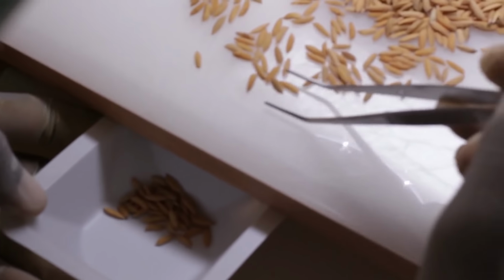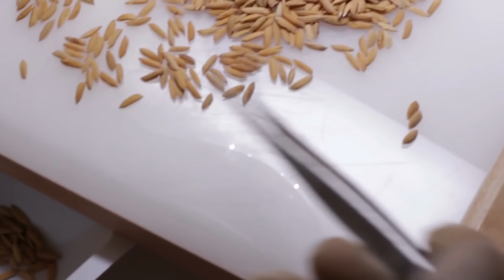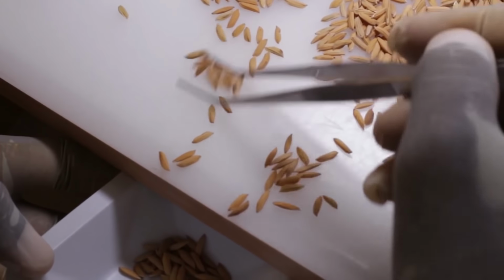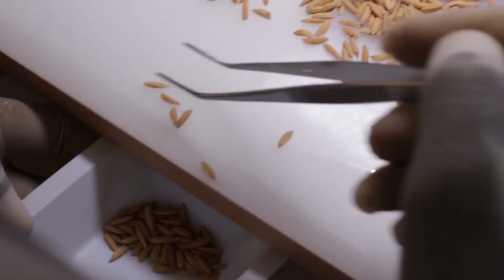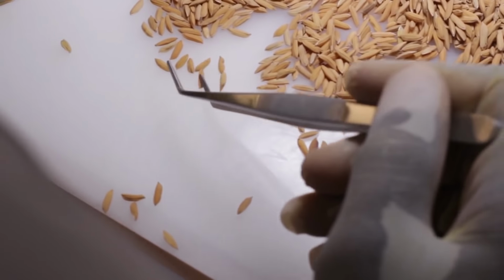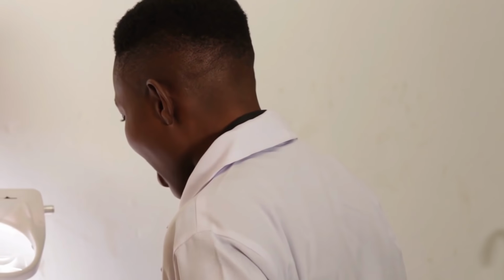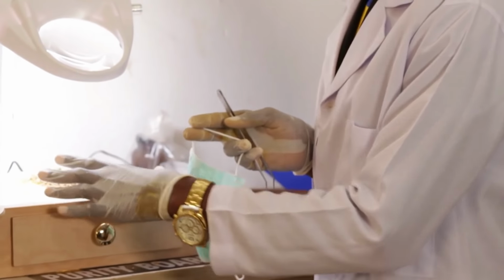You can also have other seeds, like when you have other varieties. There are some other varieties that you can differentiate from this. For example, the red rice, which is one of the varieties we don't want to see in our seeds. So you can help separate it here, and when you separate, you calculate it by weight and know the percentage of each. And that tells you whether the rice is actually pure or not. So you are also expected to put on your nose mask in case the rice is dusty enough.